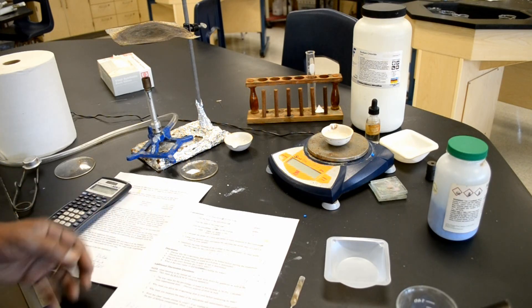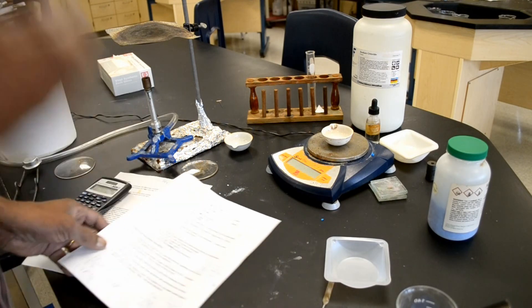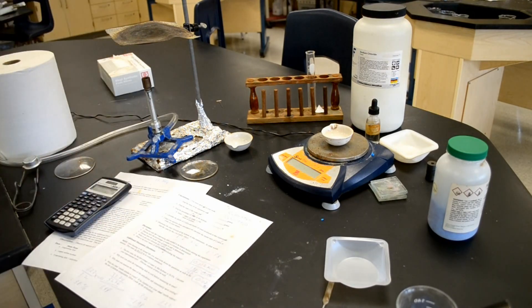It's got a little error there. So, at any rate, that's really how you do the experiment. I got a little error, but that's expected since I was kind of rushing this experiment. At any rate, that's how you do it. And hopefully, when you do the actual experiment, it'll come out a little bit better.